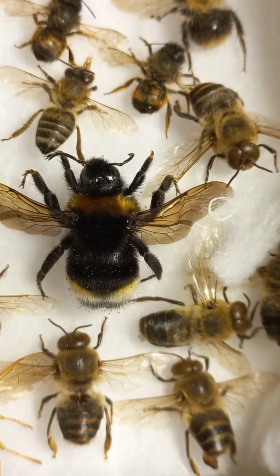Let's talk about special pollen collecting structures of honeybees. Where are they located? They are located on the hind legs. The hind legs of worker honeybees are specialized for collecting and carrying pollen. The inner segment on the hind leg is covered with numerous hairs, forming special pollen combs.